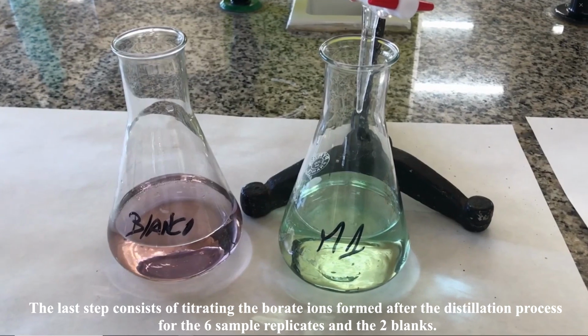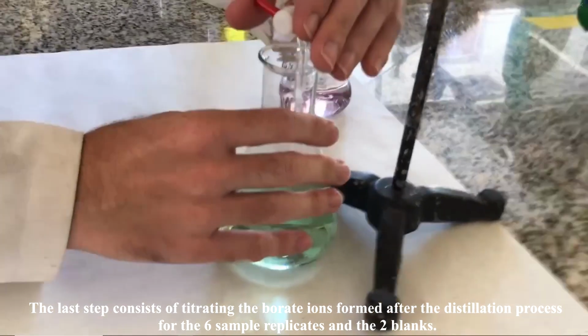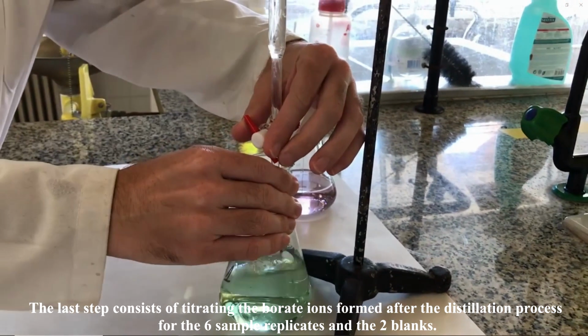Sample titration. The last step consists of titrating the borate ions formed after the distillation process for the 6 sample replicates and the 2 blanks.